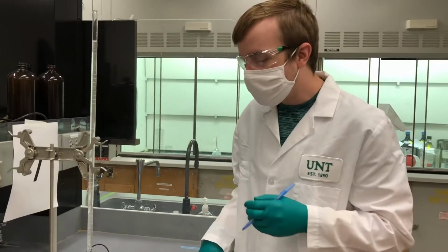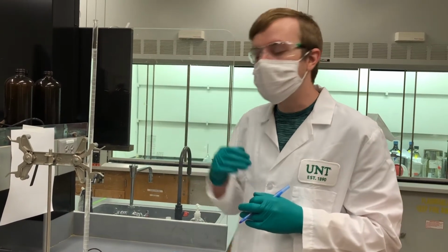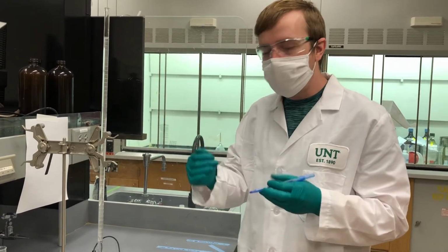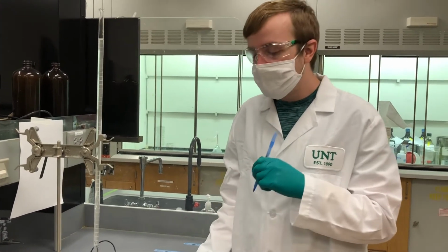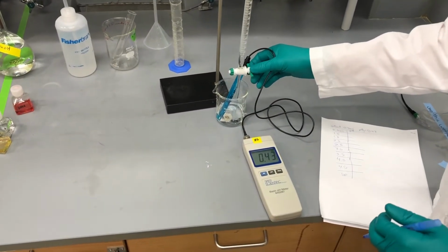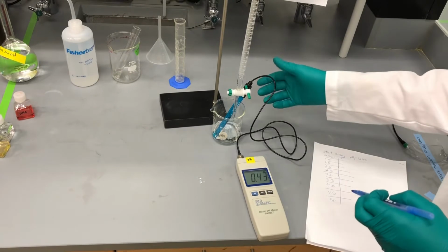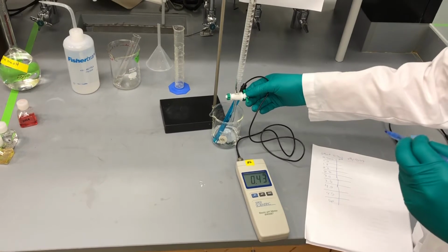As you get closer to the equivalence point, you're going to see that the pH is going to start increasing a lot faster, and then it'll stabilize as shown in that pH curve. What you need to keep in mind is that as you get closer to that equivalence point, you need to go at smaller intervals of sodium hydroxide added, so that you can track those pH changes. Okay, so we're starting at 0.3 milliliters. At every interval mark that you're going to measure at, you should go ahead and pause your titration, just so that you get the best and most accurate results.